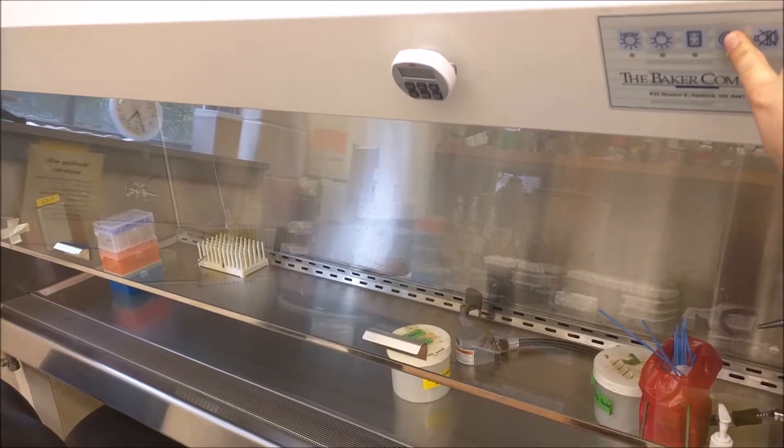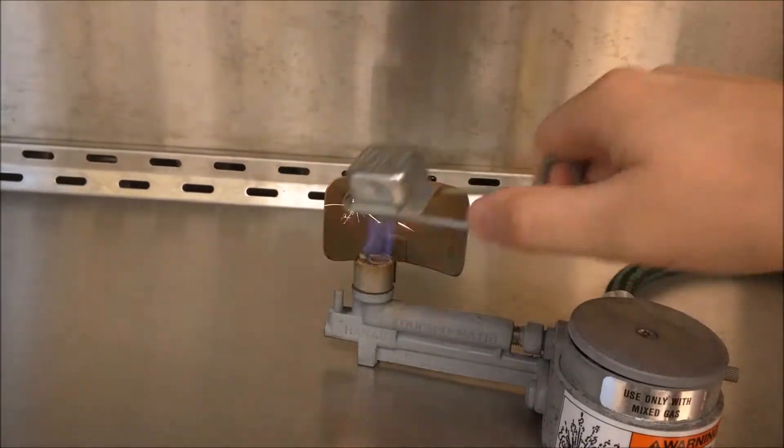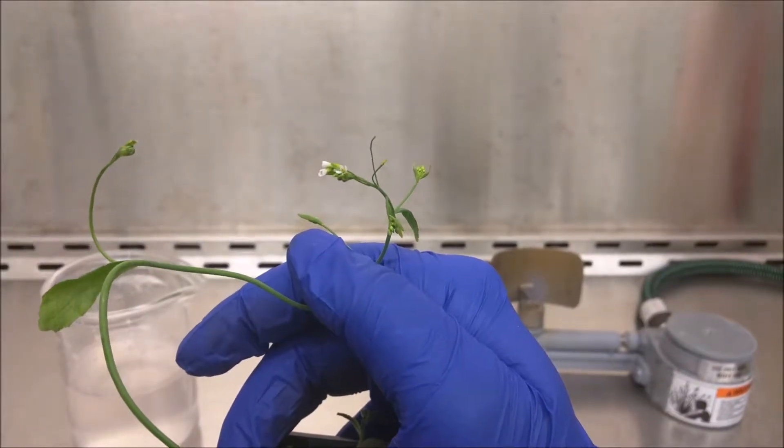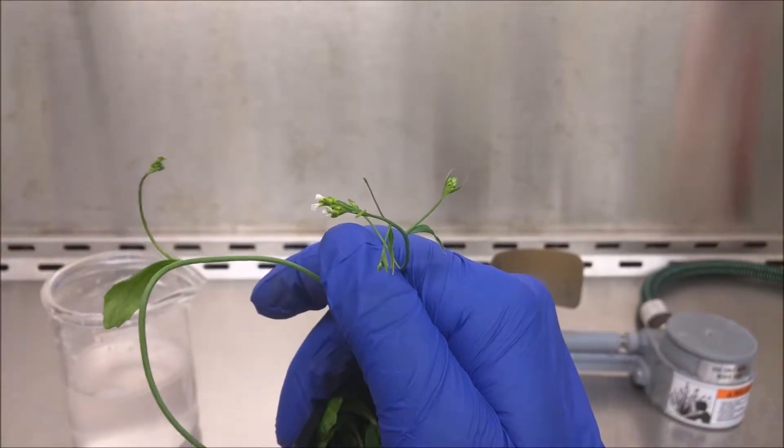Time to get our sterile technique on. Flowers that have just opened are the most receptive to transformation, so look for petals angling at less than 45 degrees.